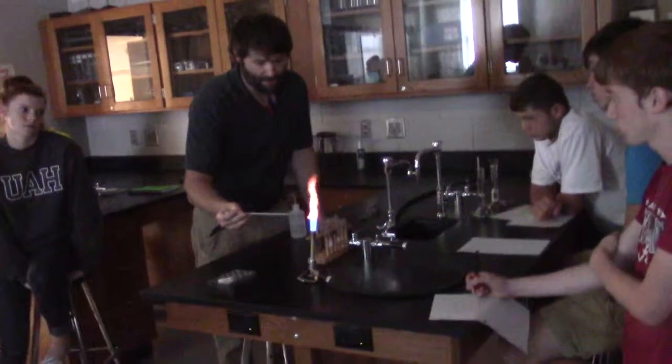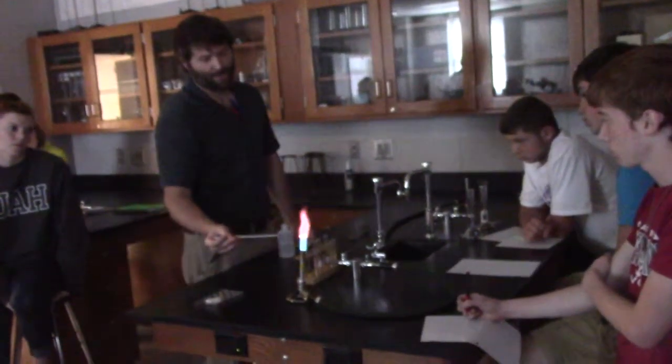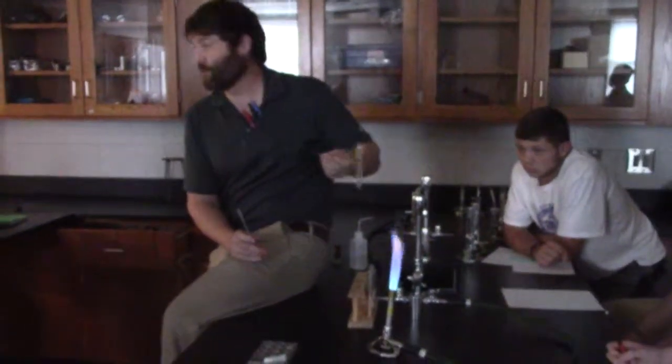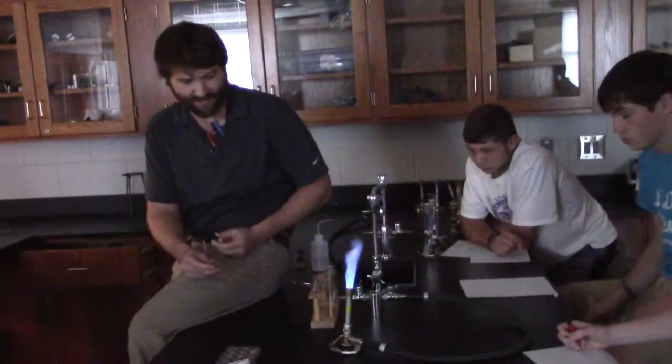By the way, if you're wondering why it's giving off some of these colors right now, it's because it's not a clean loop, really. I'm not actually using acid right now, which would help in my cleaning. Now, through the course of your lab, you might notice your acid turns like no telling what color. Feel free, if you want to get fresh acid and start over, go back to the hood. There will be a place to dump the acid. Dump your waste acid out and get some fresh acid in there.